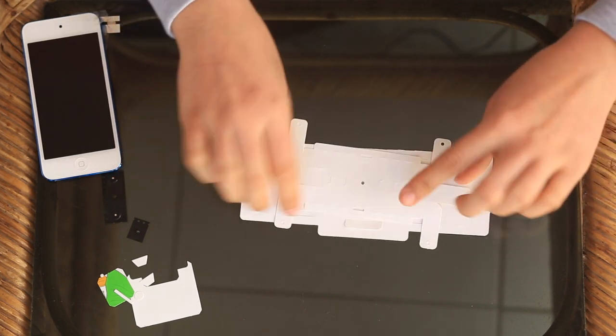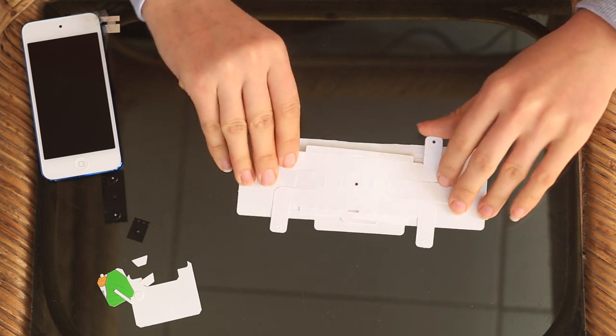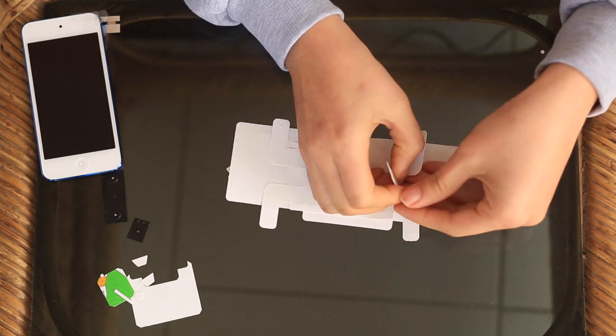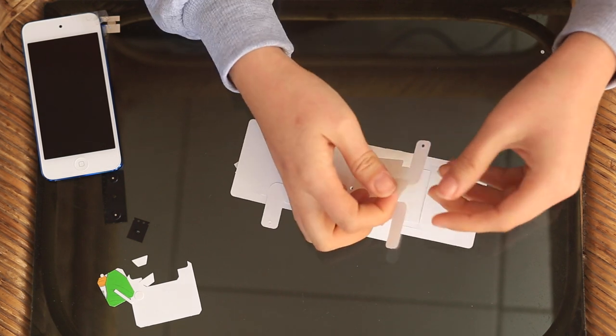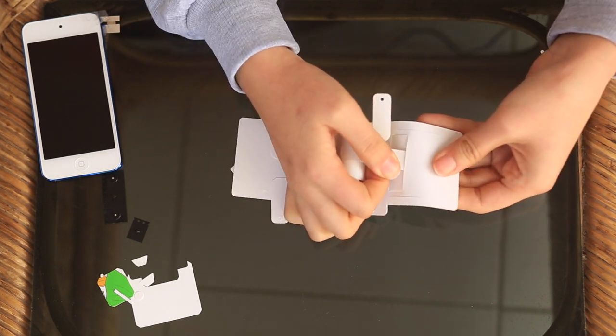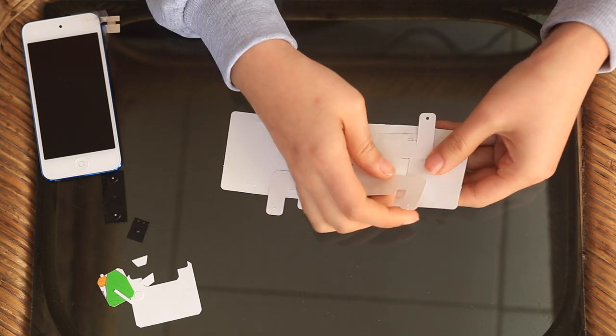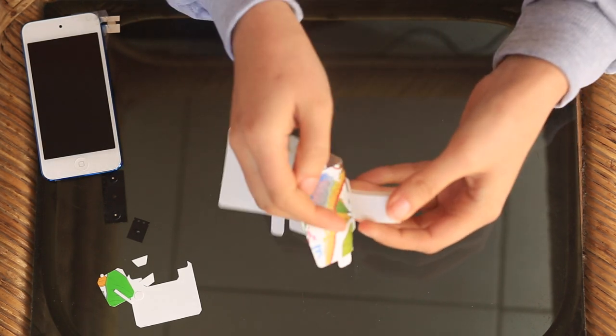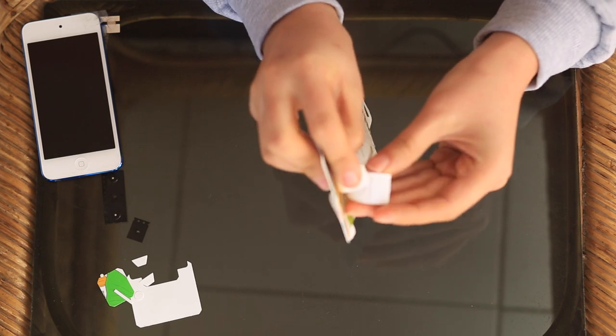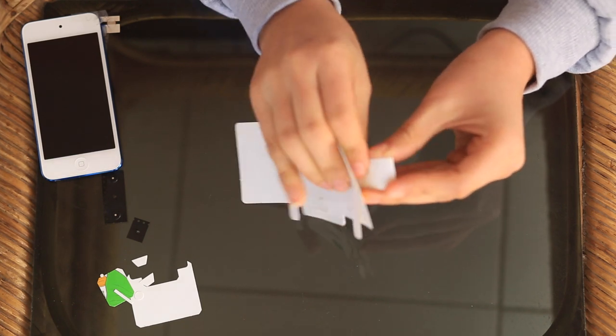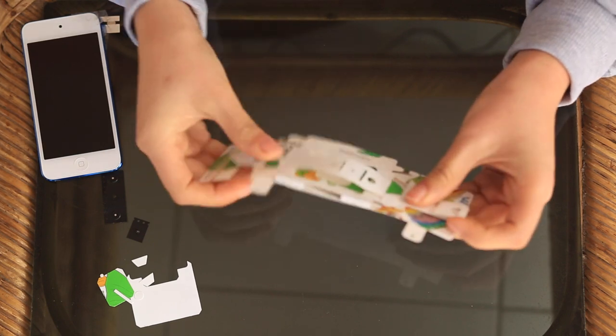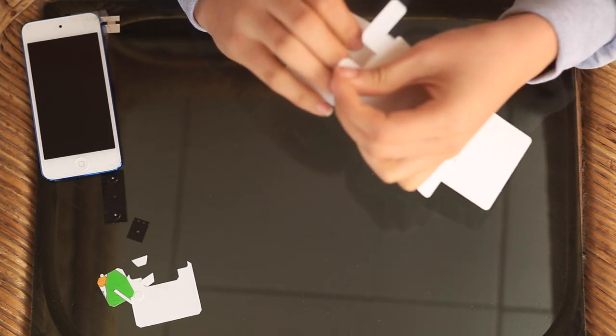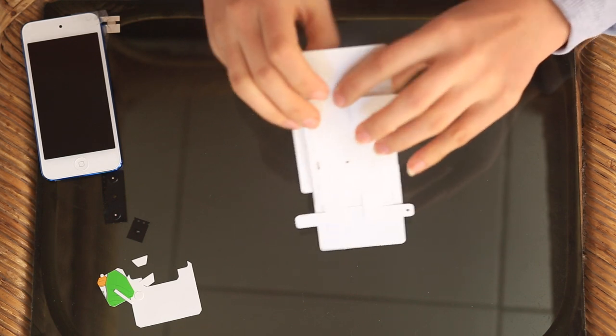One of the last steps is you turn it back to the back of the Foldscope. So you take this head part, loosen it out. You put it through this slot right here. Then on the side it comes back through and you put it into this slot here. That locks the illumination stage into place so that the entire thing is able to move independently.